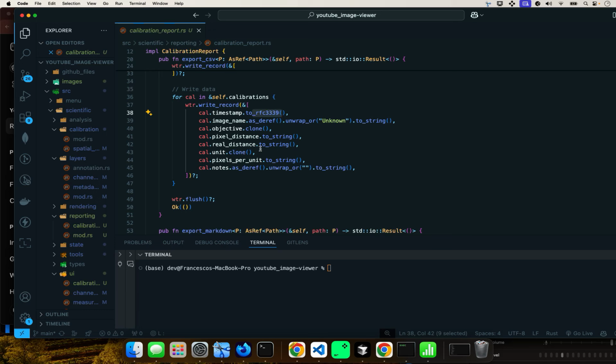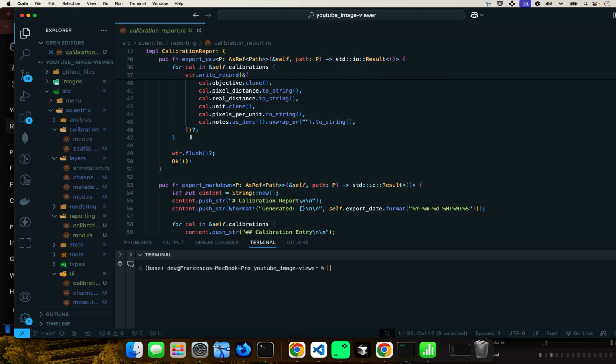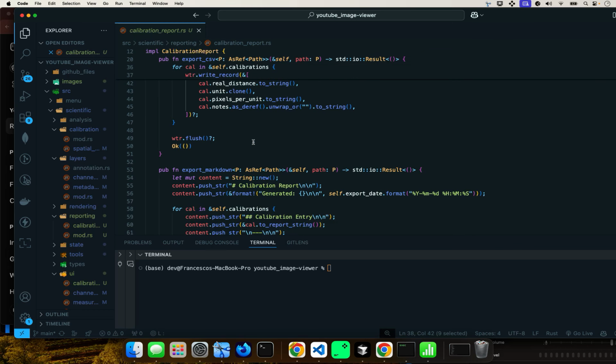Here it is going to just add the respective calibration data: the pixel distance, real distance, and unit, just what I showed you. Here it is going to ensure that all the data is written to a file, and this is just saying to indicate successful execution.